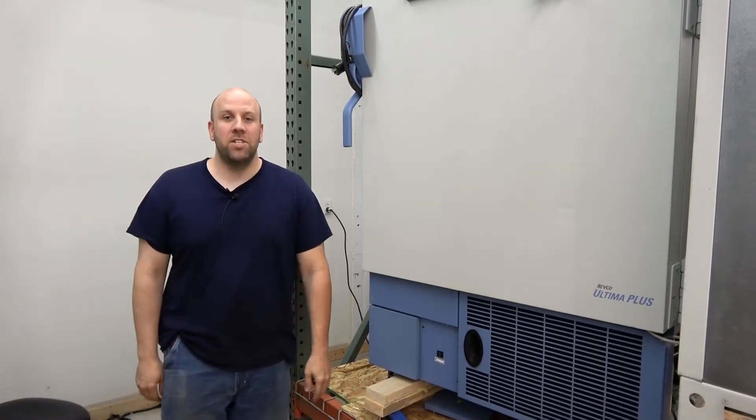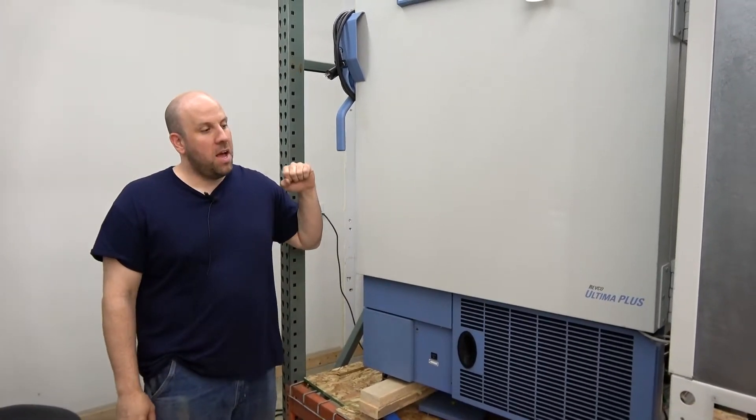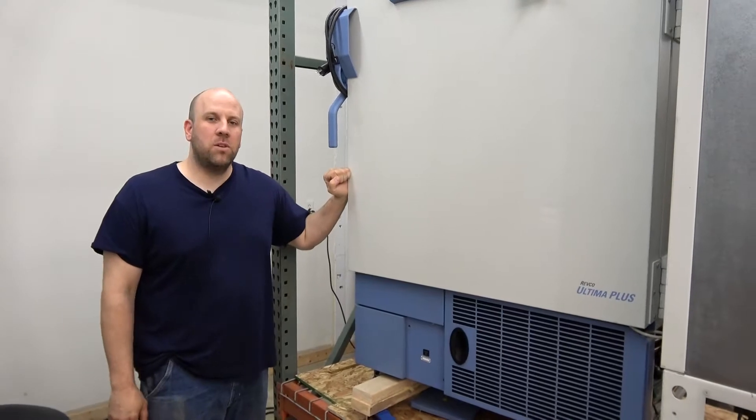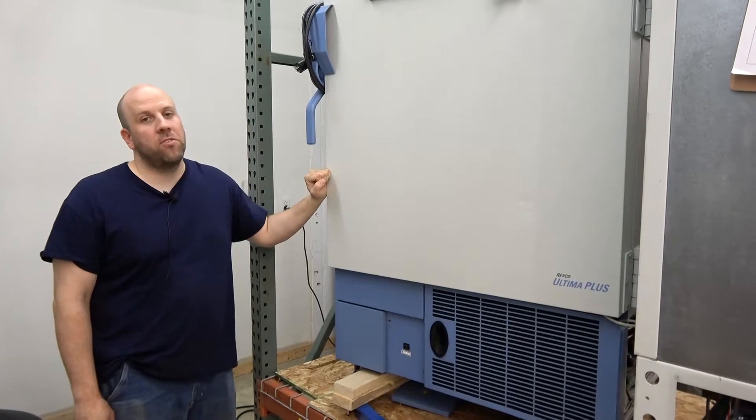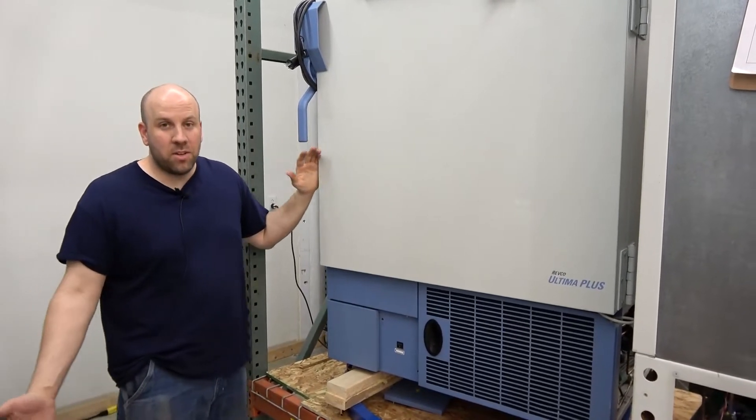Hi, my name is Joe. I'm a technician here at New Life Scientific. We wanted to talk to you guys a little bit about how we refurbish our ultra-low temperature freezers, negative 80 degrees Celsius freezers.